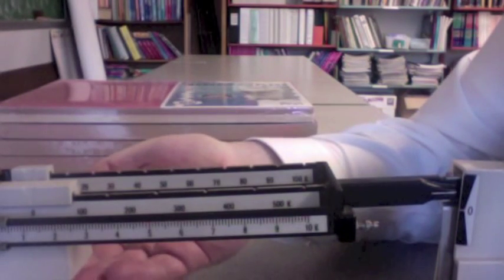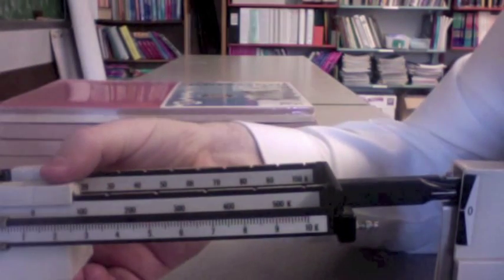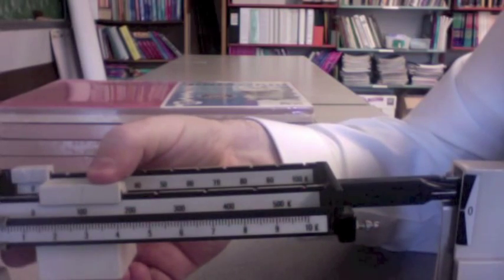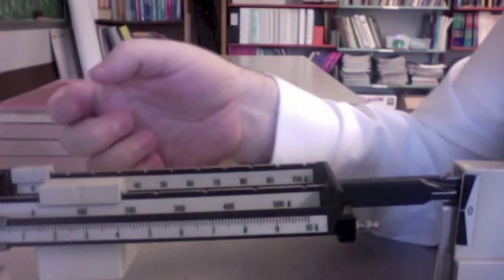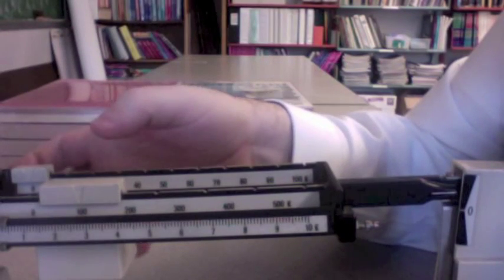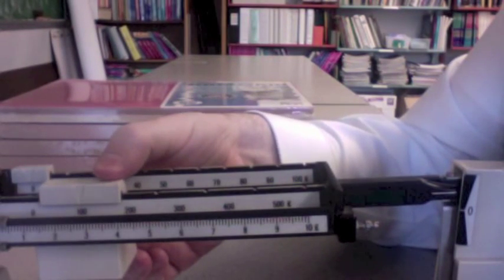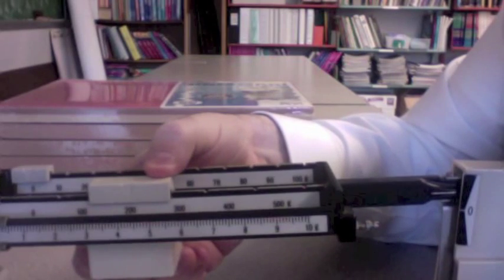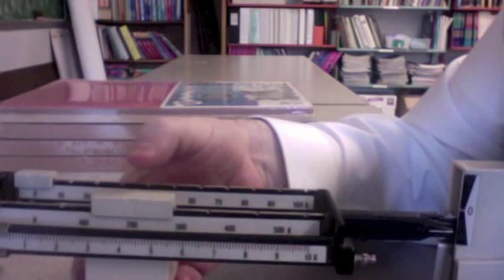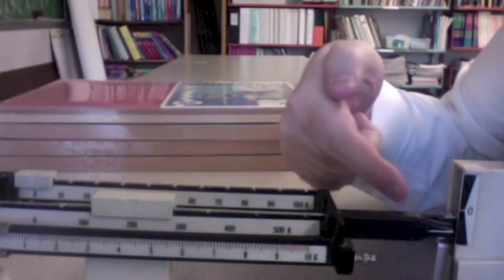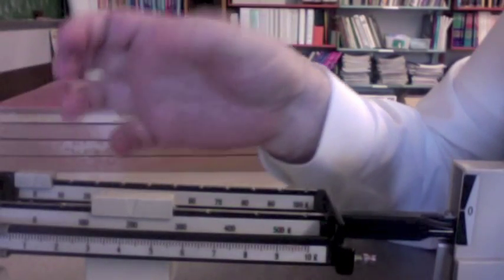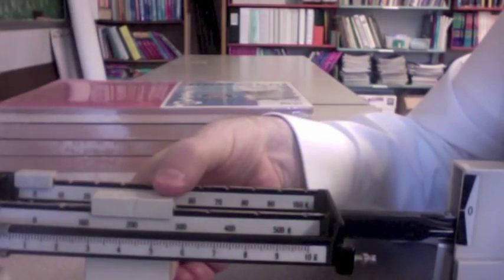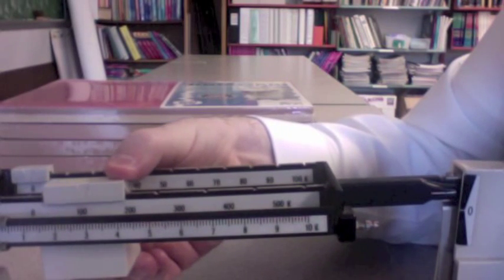I'm going to very carefully move the slider over to one hundred, and it locks into position. And notice that the pointer didn't move, so what I know is that the block has a mass greater than one hundred. I'm going to slide it over to two hundred and see what happens. Ooh, did you notice that it went down? So now I know that the block has a mass that is less than two hundred. So I'm going to bring it back to one hundred. Two hundred is just too much.